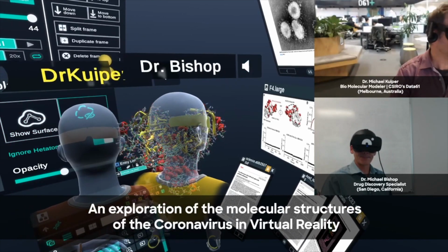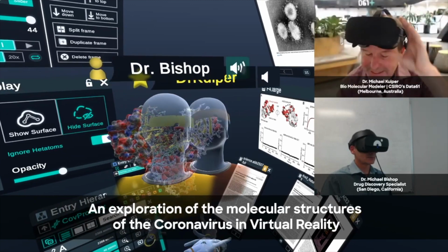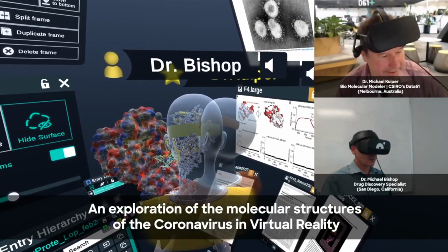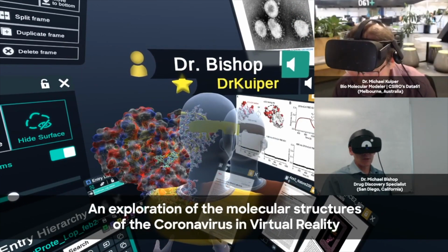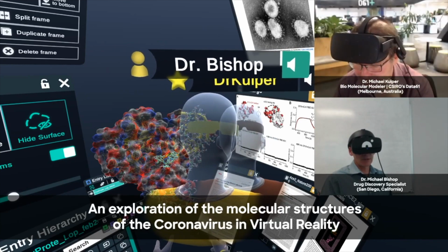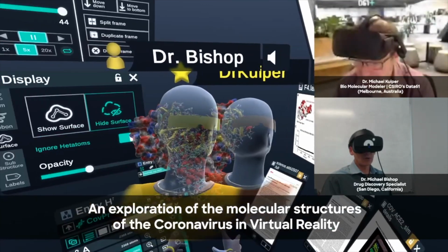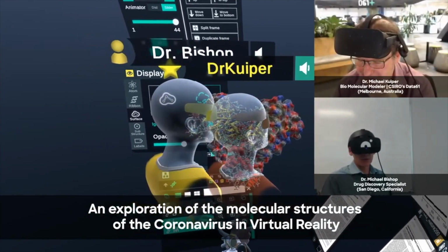Question. One of our audience members wants to know if you can show the protease docking with some other molecules. Mike, do you have the model ready to show docking with other inhibitors, other small molecules? And if not, why don't you walk us through the process you would use to quickly do that?